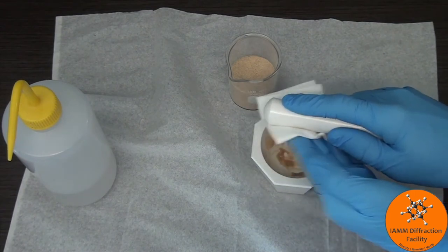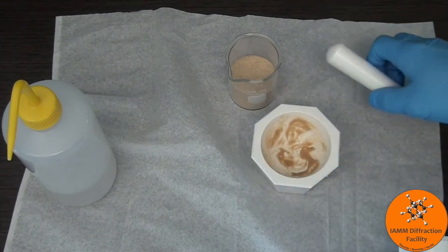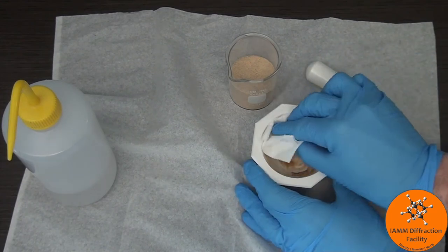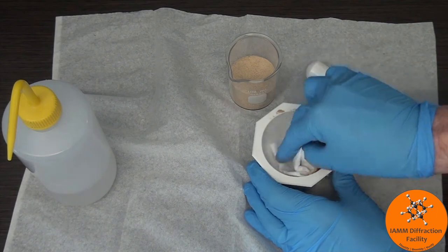Not perfect, but it's looking better. Put that to the side. Then I will basically just take this over to a trash can, kind of wipe out all the sand, throw it away.